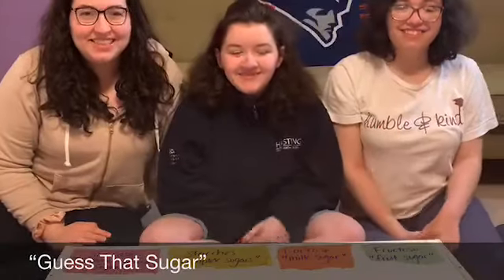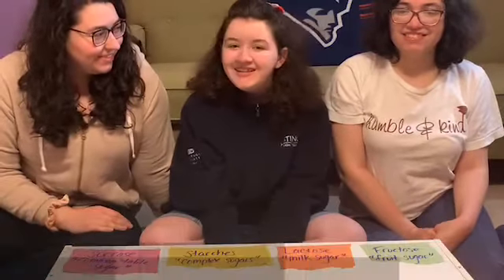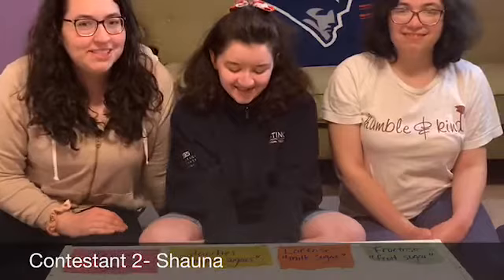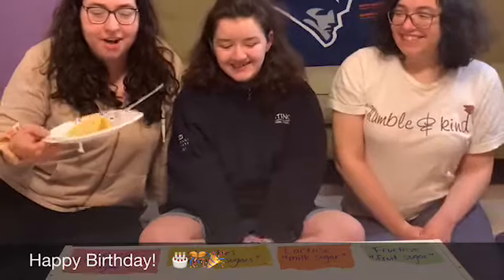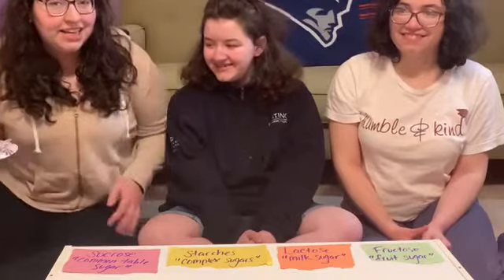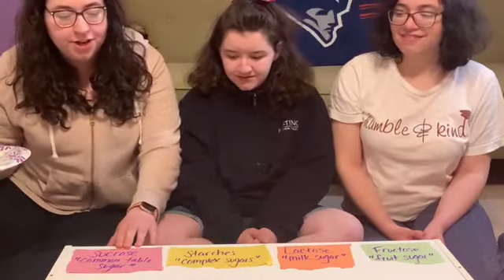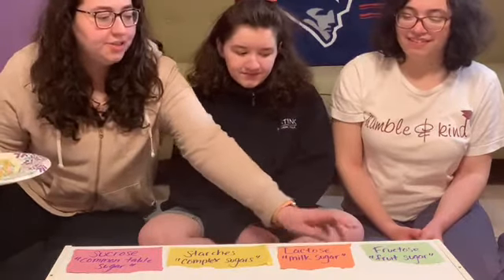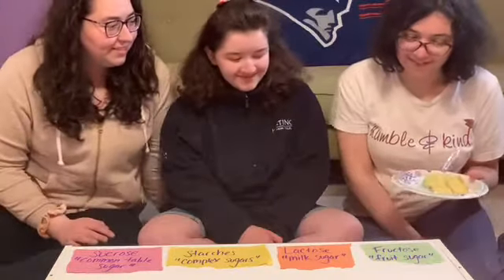Come on, let's go. Hello, chemists, and welcome to Guess That Sugar. Today on the show, we have Contestant 1. Contestant 1, tell us what your name is. Leanne. Beautiful. How about you, Contestant 2? Shauna. Awesome. How about Contestant 2 goes first because it is her birthday, and the first object up to guess is a slice of birthday cake. Now, the contestants have to guess whether the sugar contained in the frosting of this cake is a sucrose, starch, lactose, or fructose.